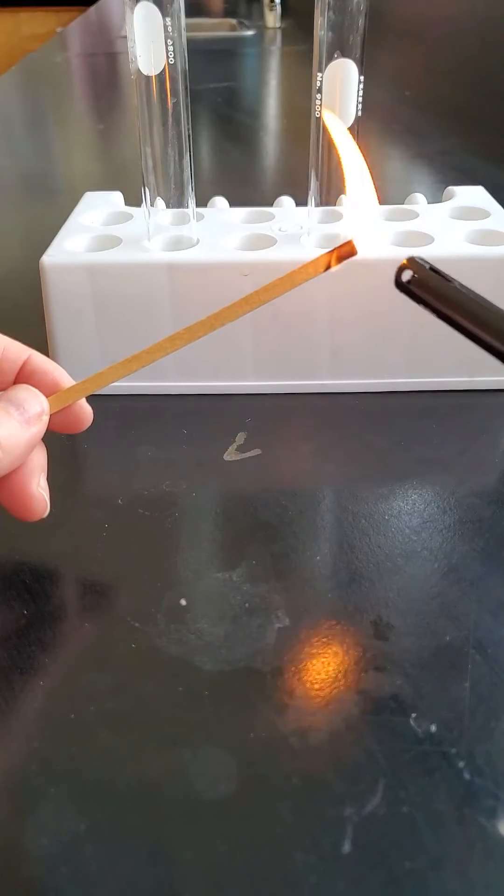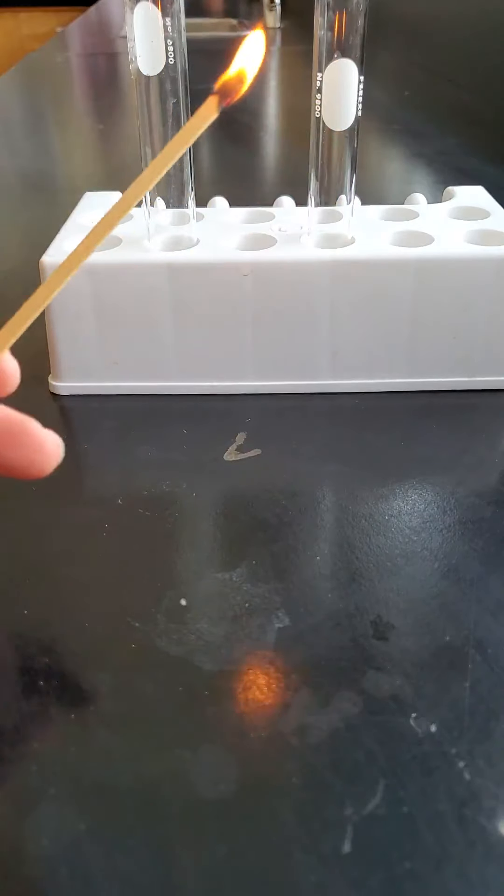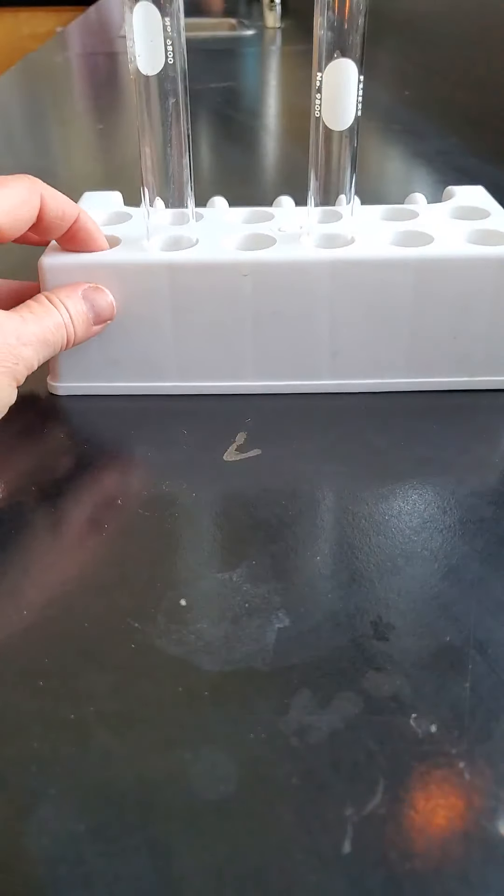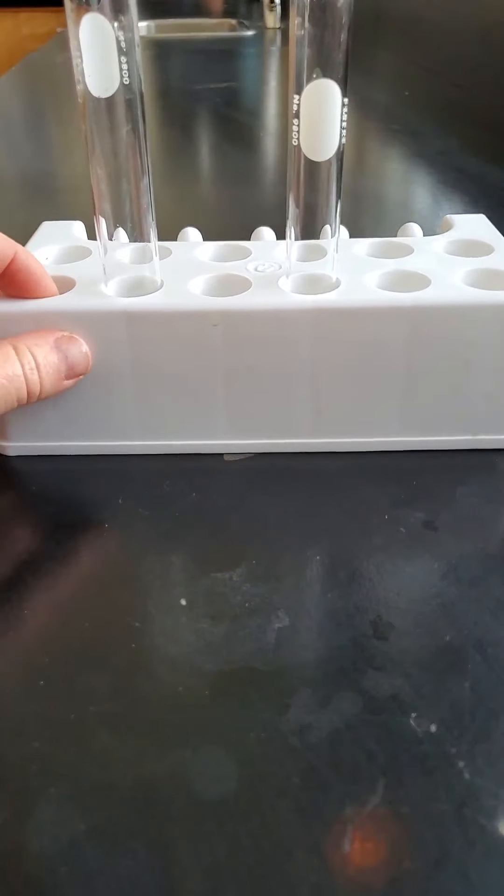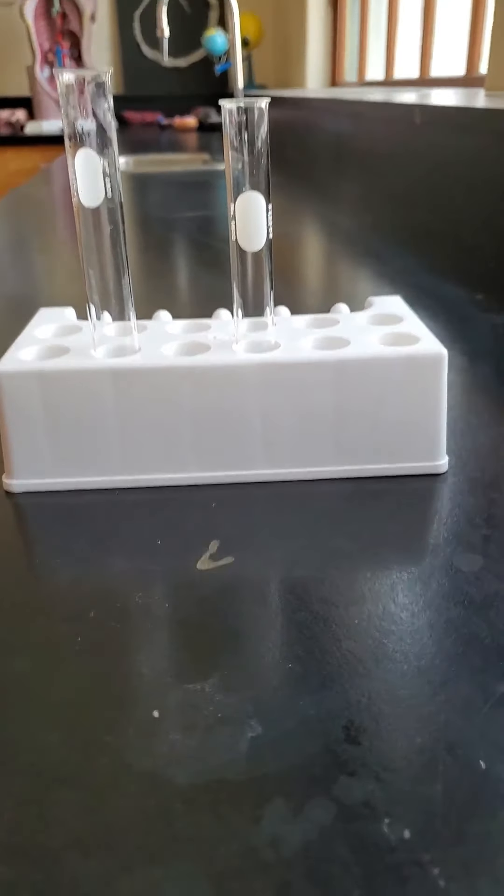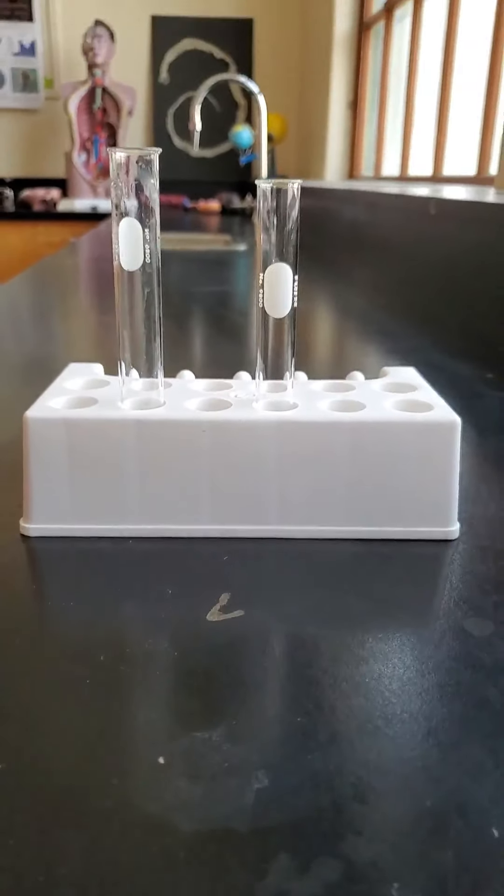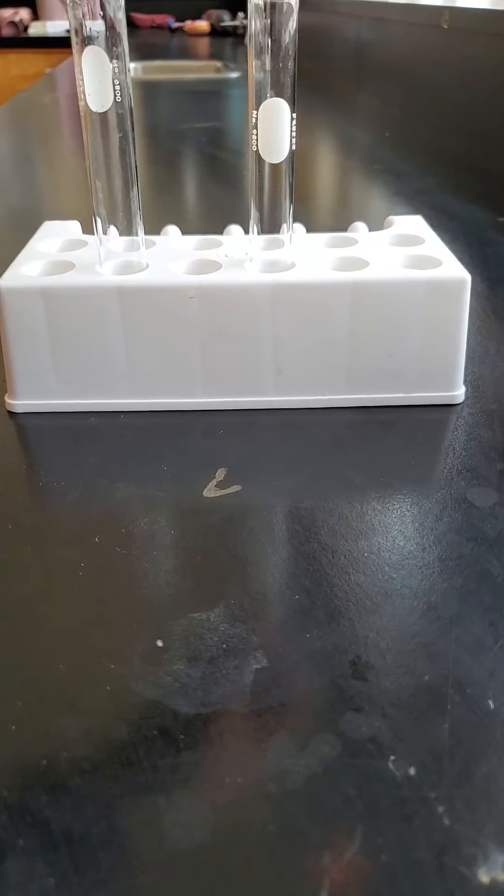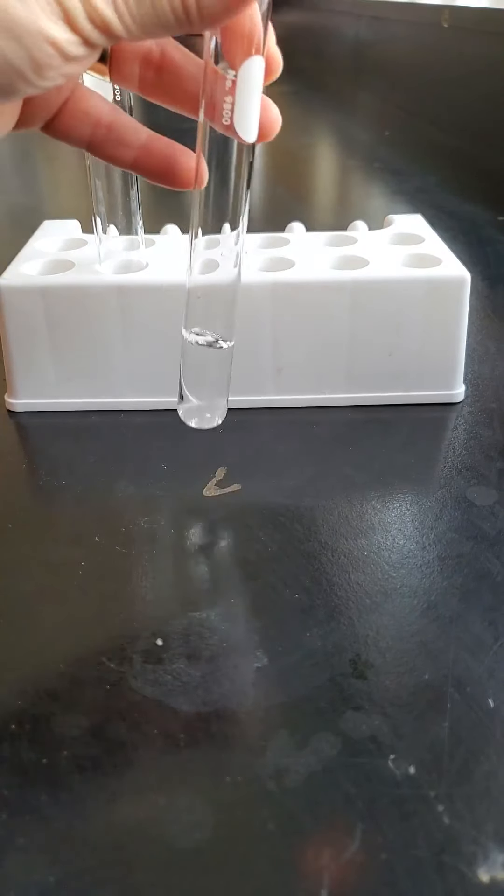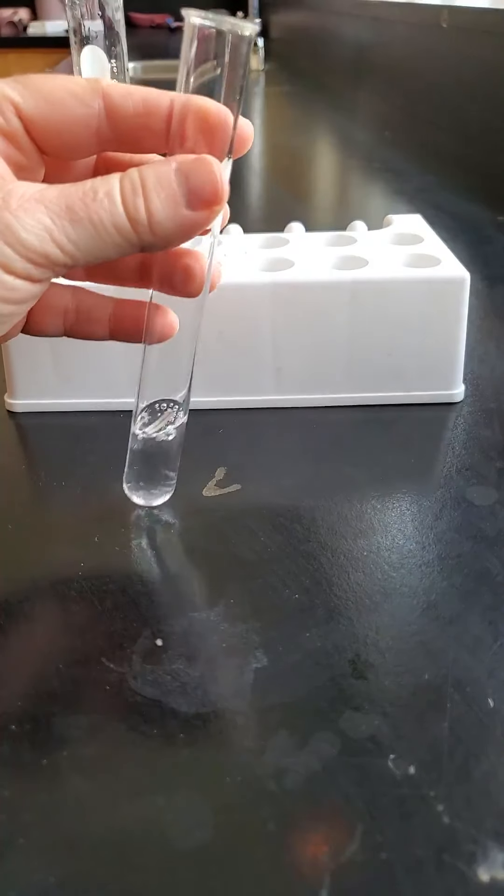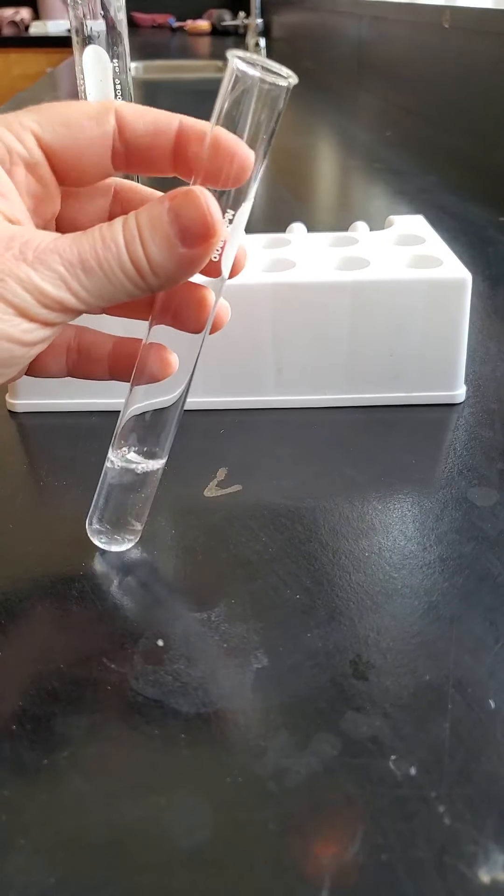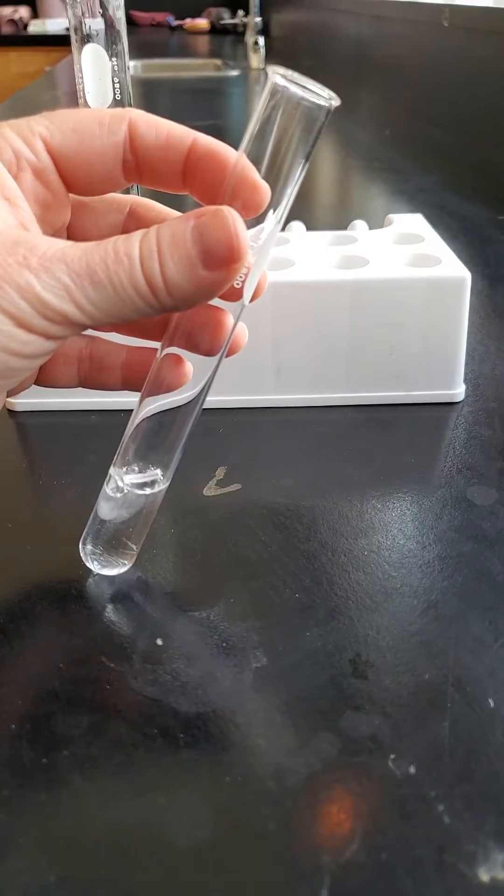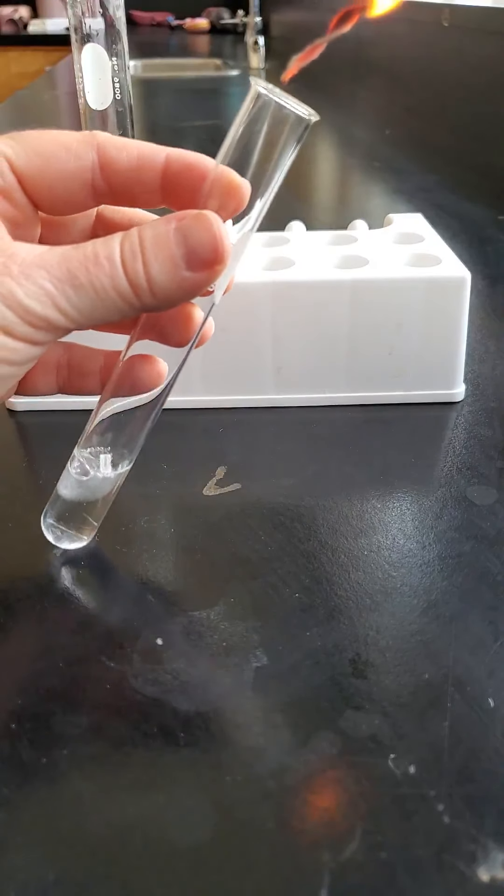We're going to see what happens when we put it into a fresh batch of magnesium in hydrochloric acid. I'm going to tilt my camera up a little bit so you can see the top here. I take one of these pieces of magnesium ribbon and drop it in there. It's bubbling away. Give it a few seconds to make some of that gas and let's listen carefully to what's going to happen if I put my burning splint in there.